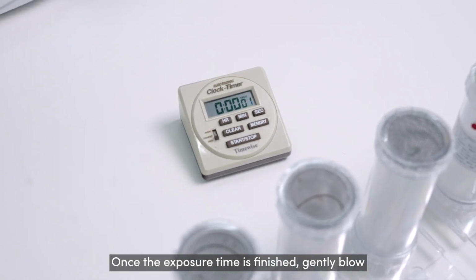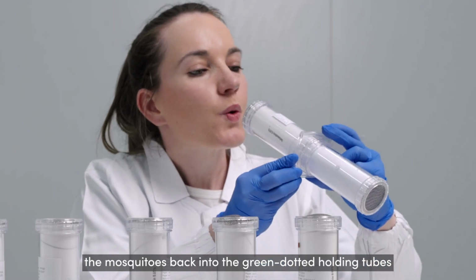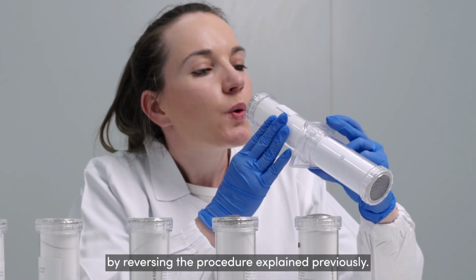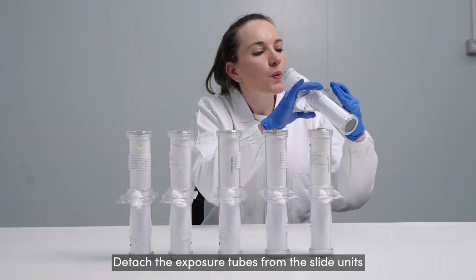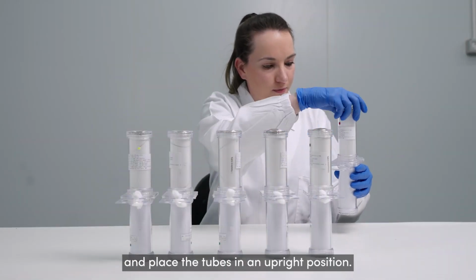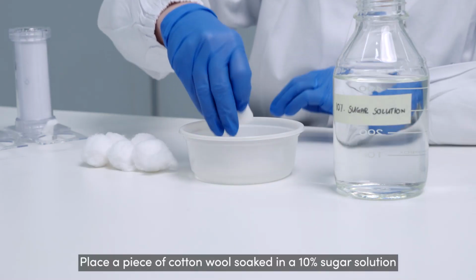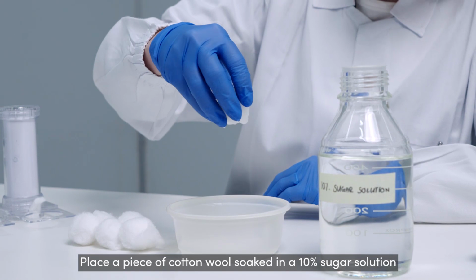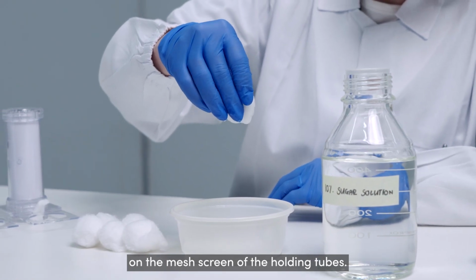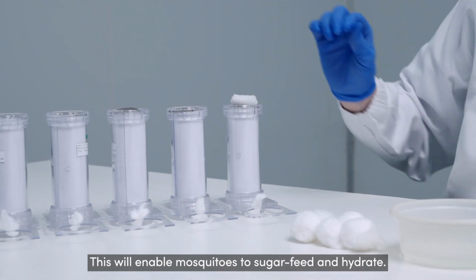Once the exposure time is finished, gently blow the mosquitoes back into the green dotted holding tubes by reversing the procedure explained previously. Detach the exposure tubes from the slide units and place the tubes in an upright position with the mesh screen facing up. Place a piece of cotton wool soaked in a 10% sugar solution on the mesh screen of the holding tubes. This will enable mosquitoes to sugar feed and hydrate.